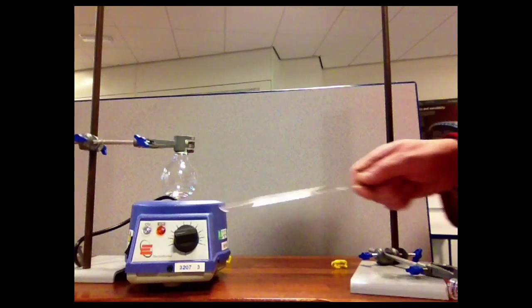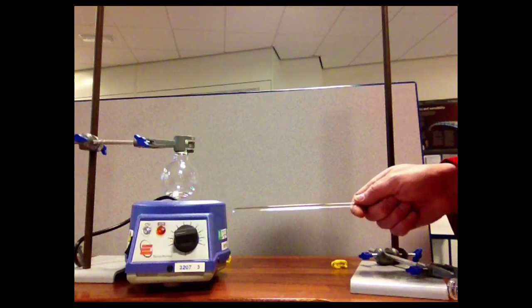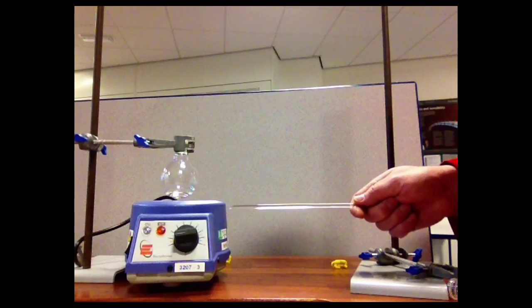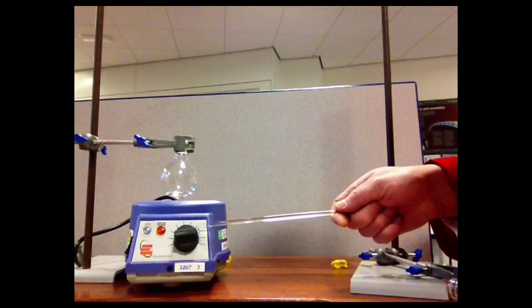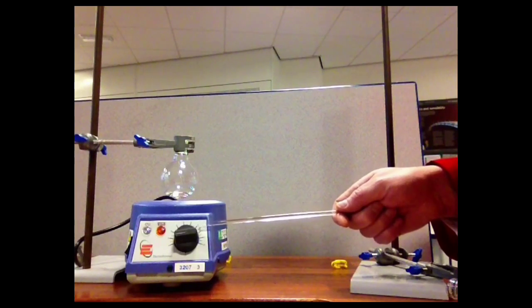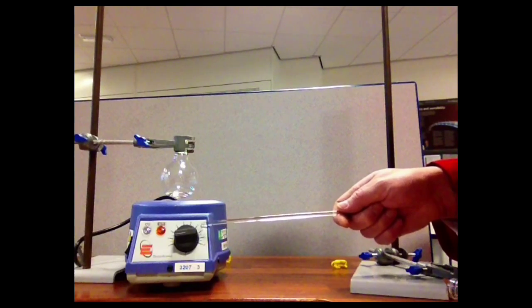The heating is provided by a device known as an electric heating mantle, and this works without a naked flame, so in terms of flammable materials it's much safer, and it also has a much greater degree of controllability for the heating process, so a much gentler heat can be provided than would be provided with a Bunsen burner.